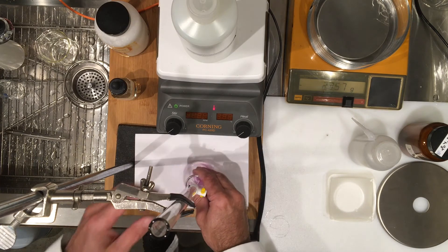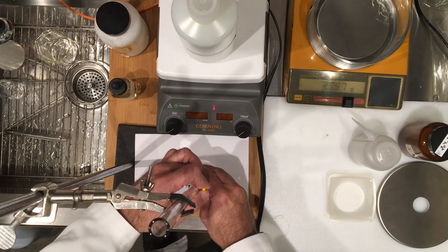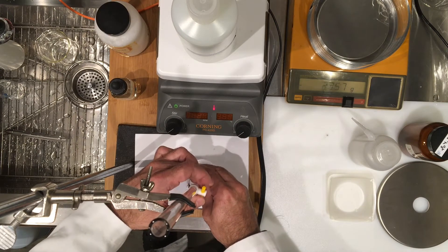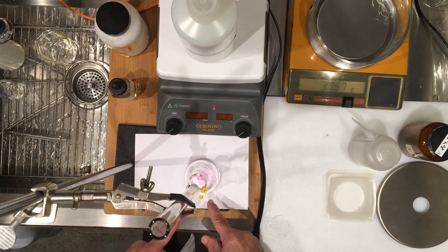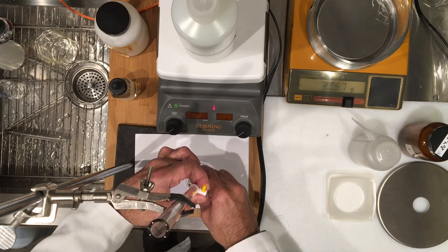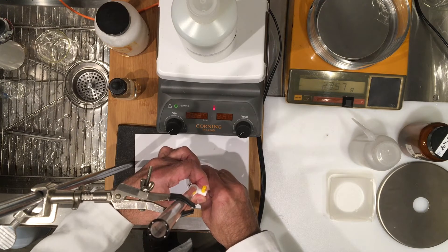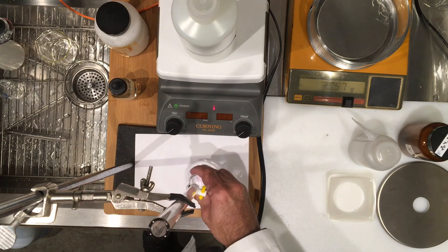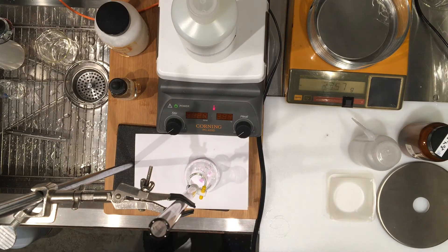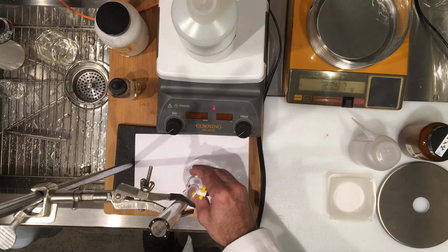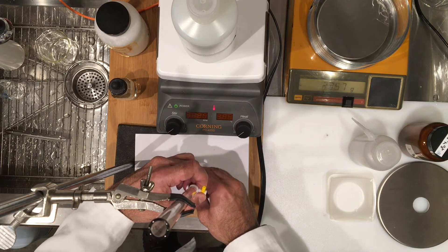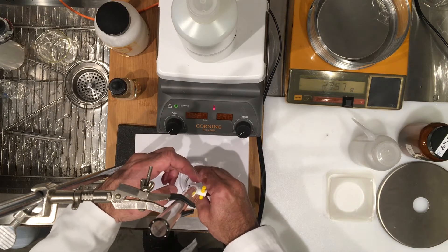Where the solution falls it's pink, so now I'm getting closer because there are flashes of pink with every drop of the sodium hydroxide. So I'm going to slow down the rate of adding sodium hydroxide. You can probably see how it turns into pink with every drop. I want to get it to a faint pink color and no more intense. Let's see how good I can do that.